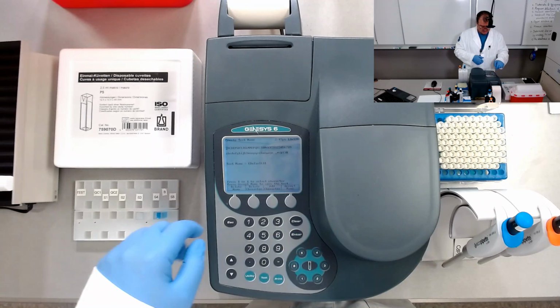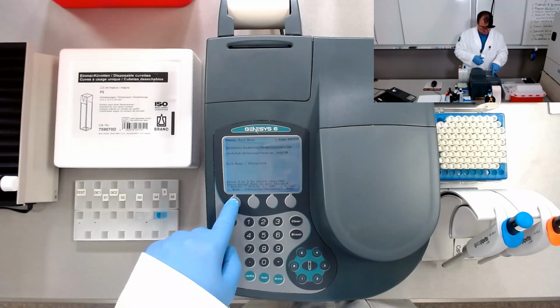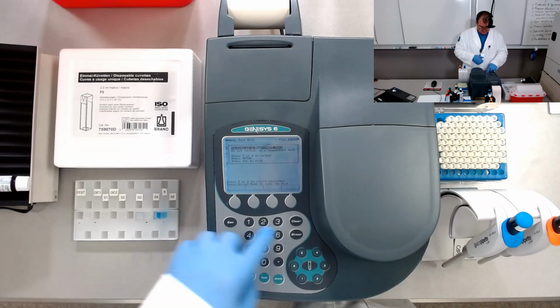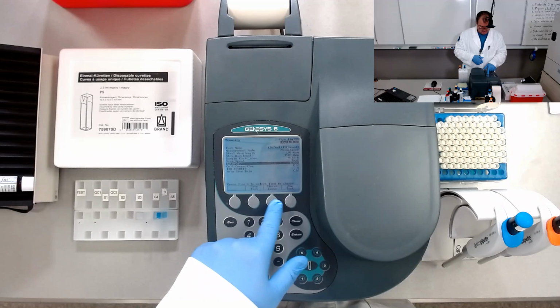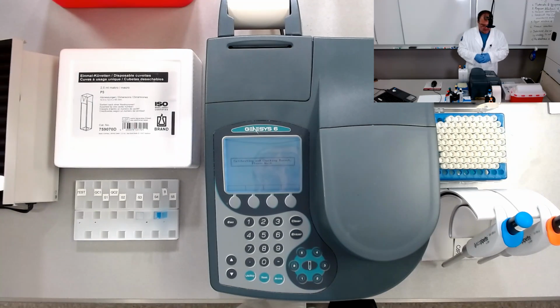Okay, accept name. Okay, so we have one run test. We'll go run test.